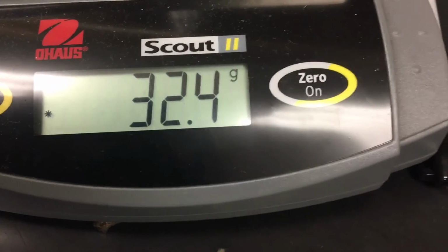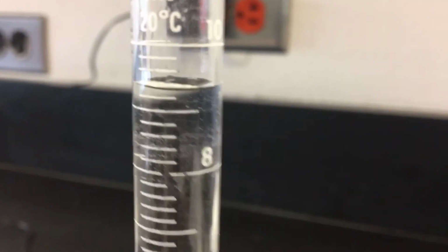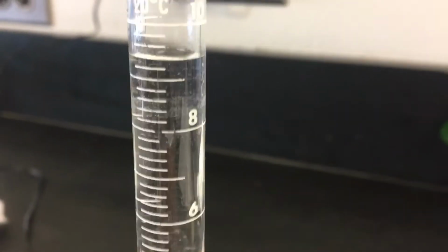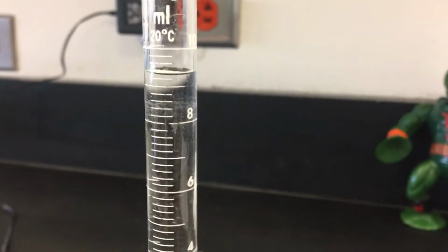So if this comes out right, which, you know, given that maybe there was an error on the first reading, maybe there was an error on the second reading, and maybe there's an error in how much water you guys see is in there. But if it comes out right, 1 cubic centimeter is 1 milliliter, and 1 milliliter should have a mass of 1 gram, which means density of water should be 1, like by definition. Are we going to get that or not? We'll see when you crunch the numbers.